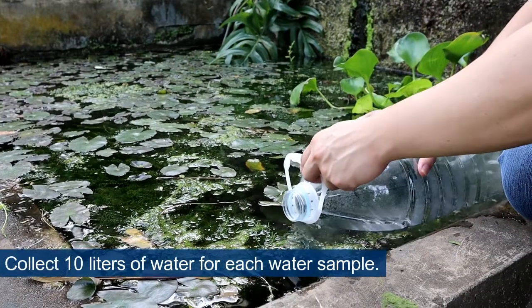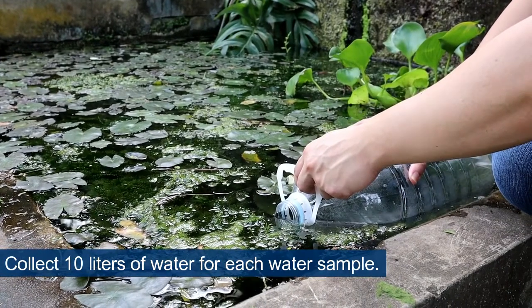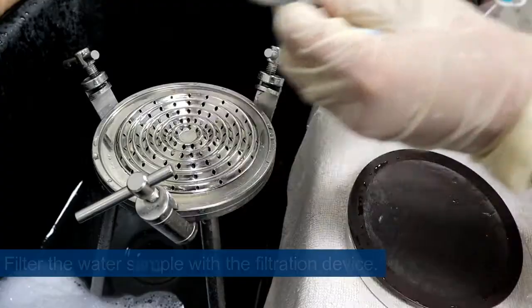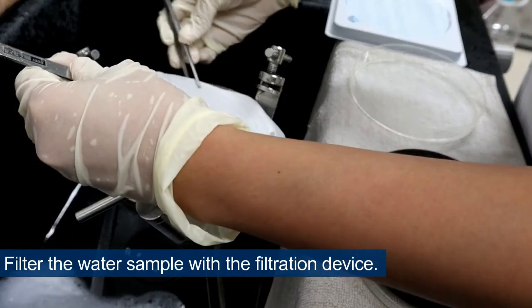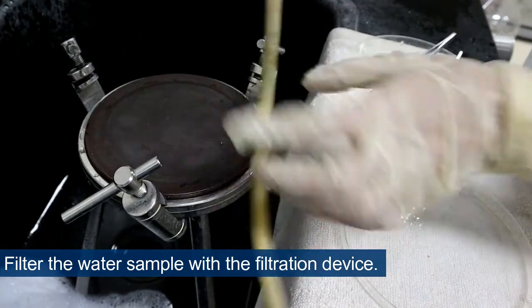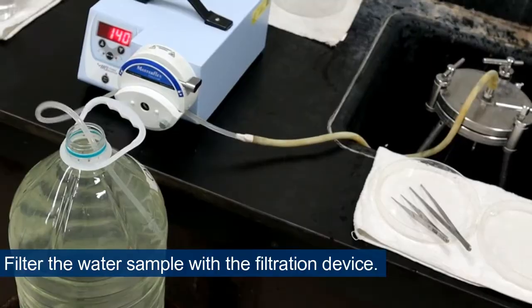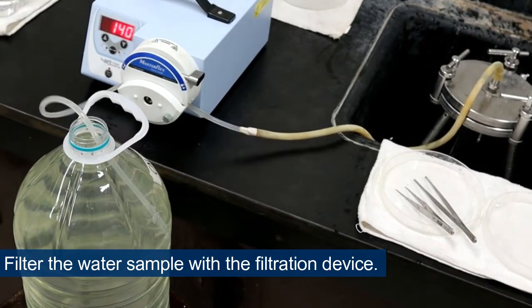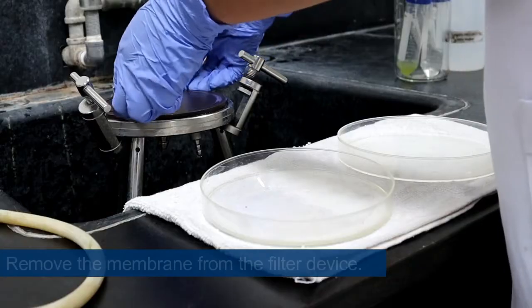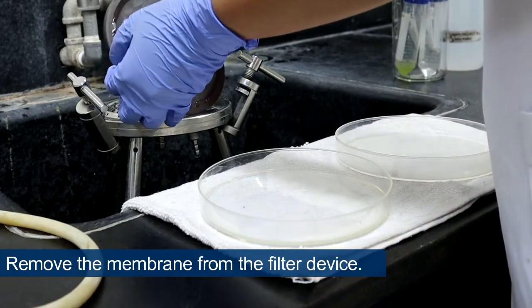Collect 10 liters of water for each water sample. Filter the water sample with the filtration device. Remove the membrane from the filter device.